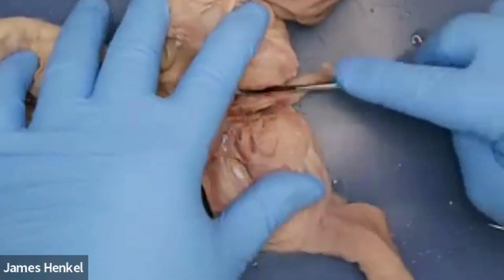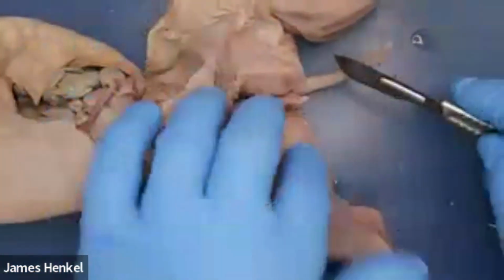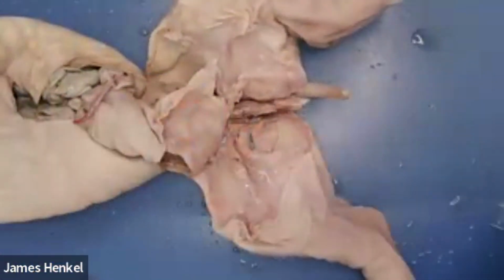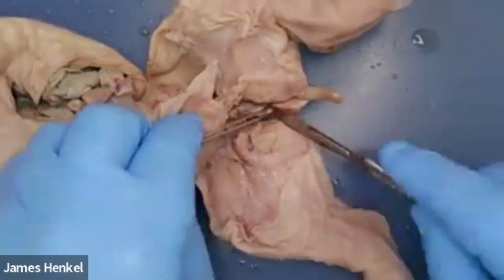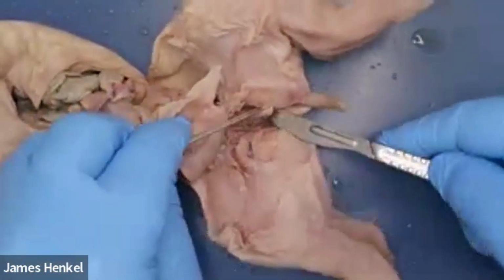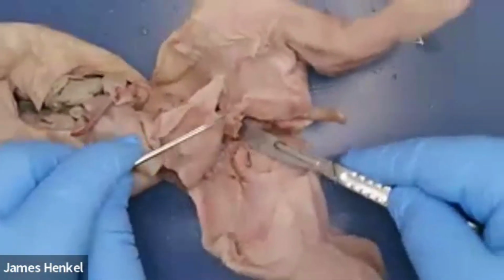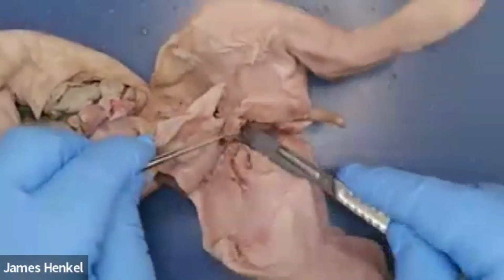You can see I'm doing the cuts again, and it opens up that pelvis a little bit more. Then I have this small rectangle of pelvic mass that I'm going to cut into. And you note I'm not cutting into the urogenital papilla or that mass underneath it. I'm trying to pull that chunk of bone out and go parallel underneath it, so I'm not cutting the reproductive organ underneath.